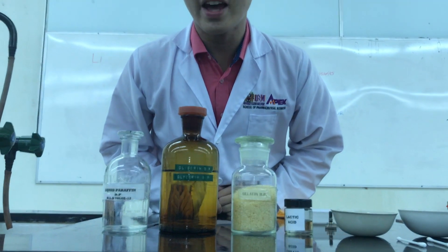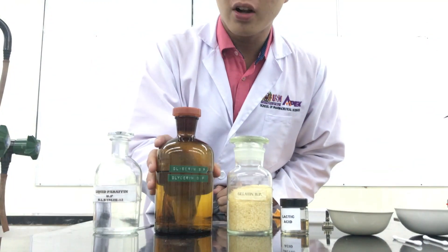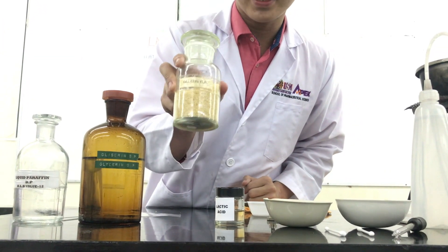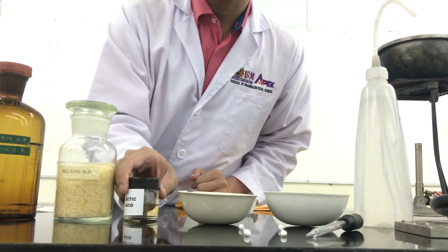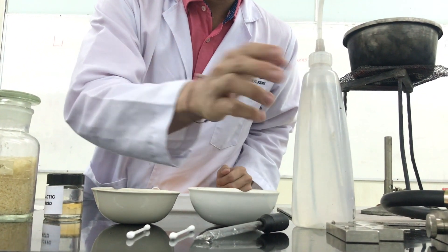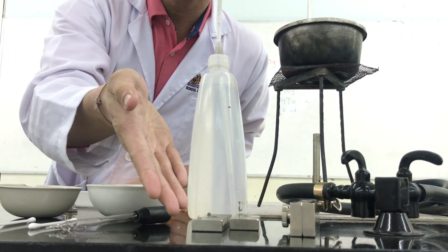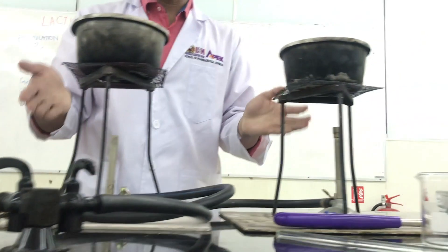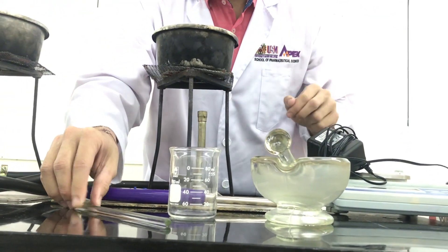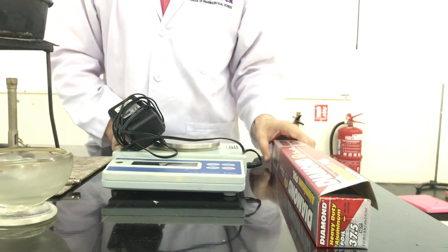Let's check on the ingredients and apparatus. What we need is liquid paraffin, glycerol (also known as glycerin), gelatin, and lactic acid. For apparatus, we need 2 evaporating dishes, cotton buds, a dropper, distilled water, the mould for making suppositories and pessaries, 2 set-ups for water bath, beaker and glass rod, mortar and pestle, weighing balance, and also aluminium foil.